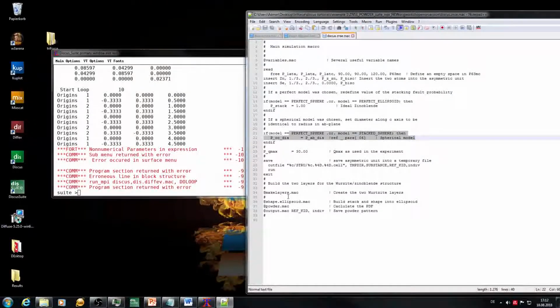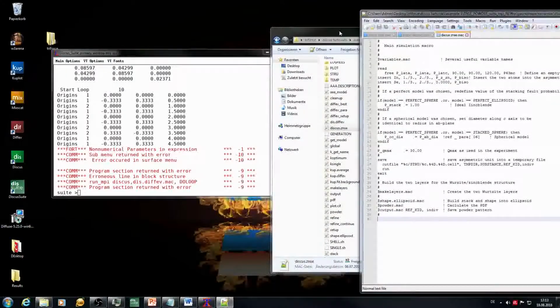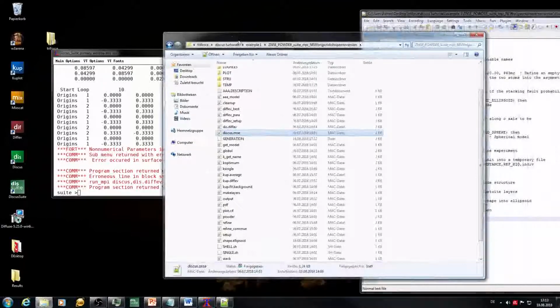It's doing that by using the make layers macro. It shapes an ellipsoid, powder, and output macro. And it creates this non-numerical parameters in expression. Sub menu returned with error occurred in surface menu. So here's already a hint where the error occurred: in the surface menu. However, we want to do it now without having the information, because most of the time this information won't be there, and it has a reason that I have chosen this error.